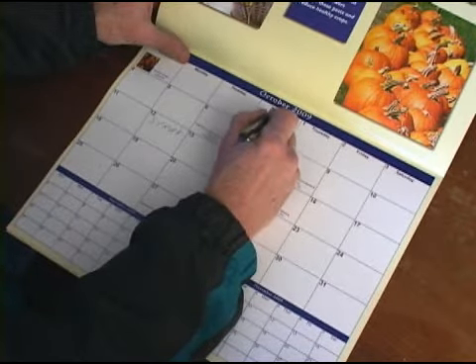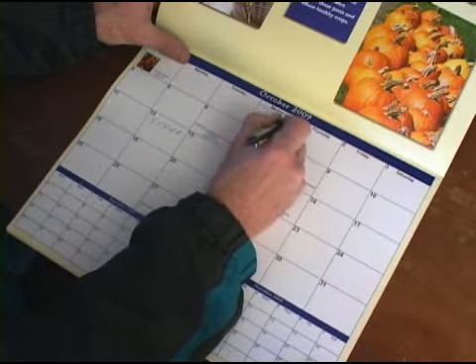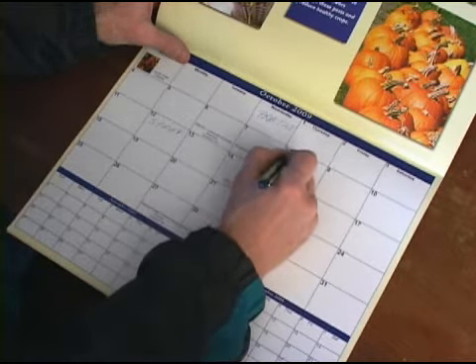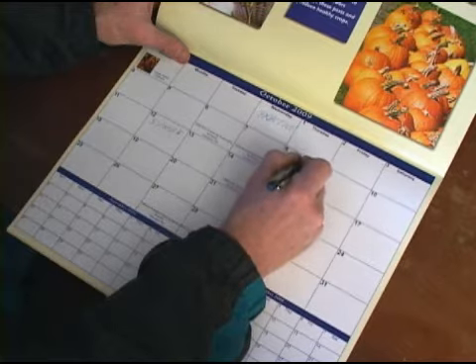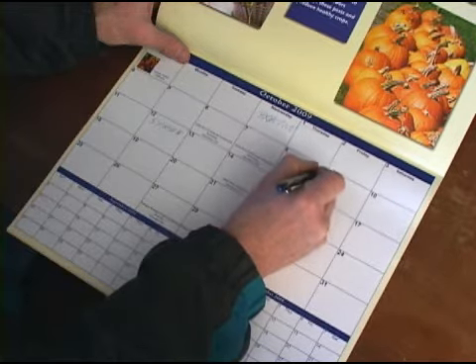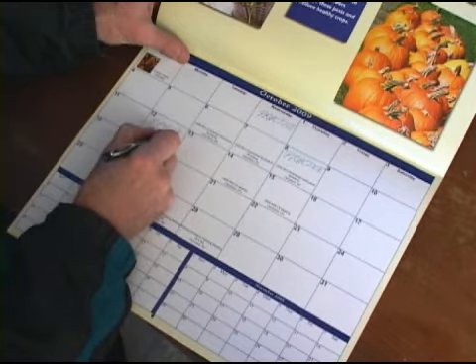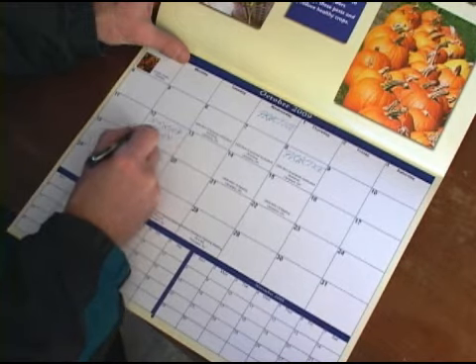Be sure to plan ahead so that you plant, spray, and harvest on the proper days. It is recommended that you spray on a Monday or Tuesday so that you don't have to harvest the 3-day sample on the weekend. Include several practice sprayer calibrations as well.